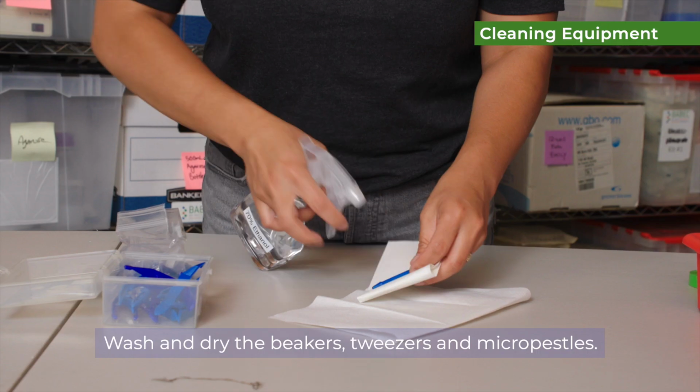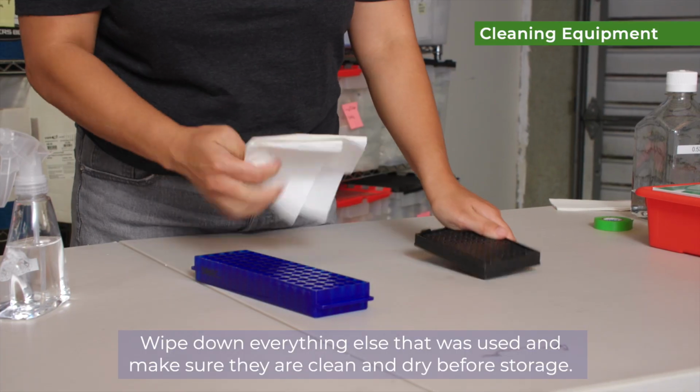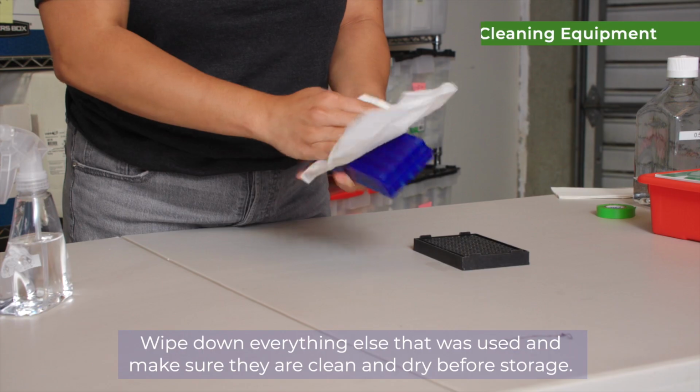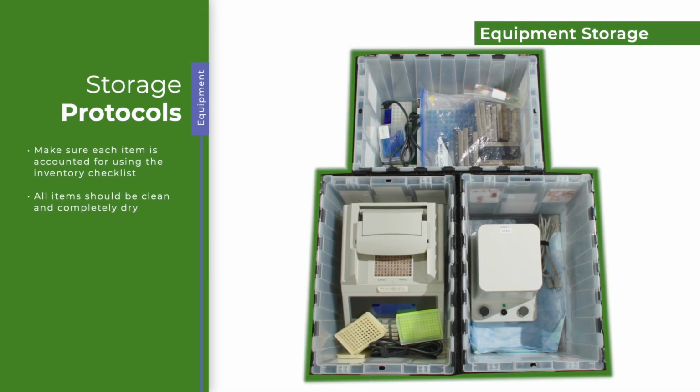Make sure all items are cooled off before handling. Wash and dry the beakers, tweezers, and micropestles. Wipe down everything else that was used and make sure that they are clean and dry before storage. Make sure each item is accounted for using the equipment checklist.